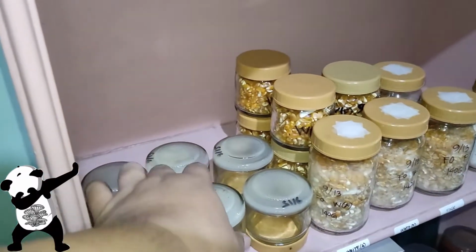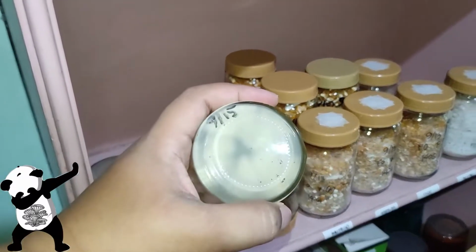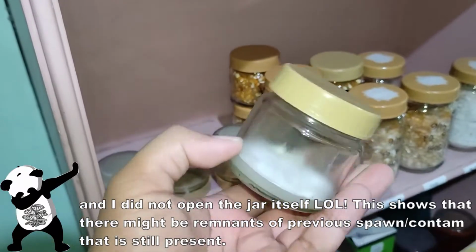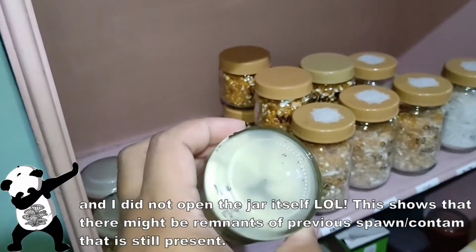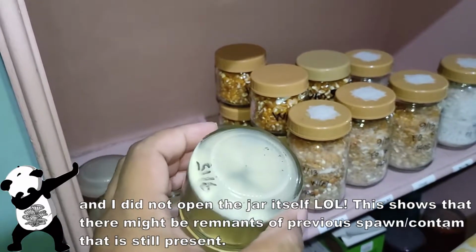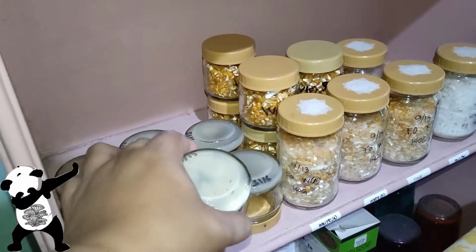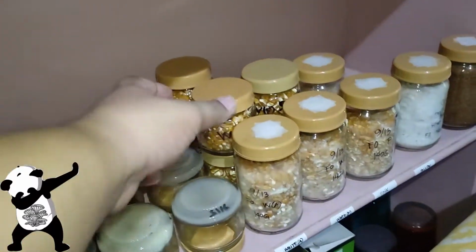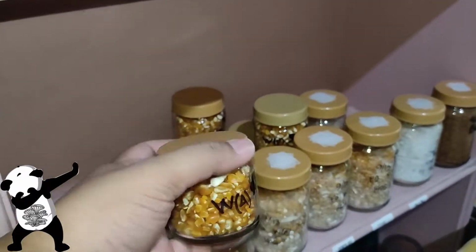On this one, which was already created on September 15, as you can see, there's something growing inside, and I'm not sure what this is. I have a crazy idea of using it to inoculate, but that's going to be in a different video. So we have an experiment here, and hopefully it turns out well.